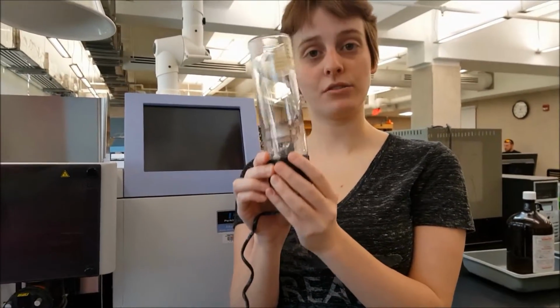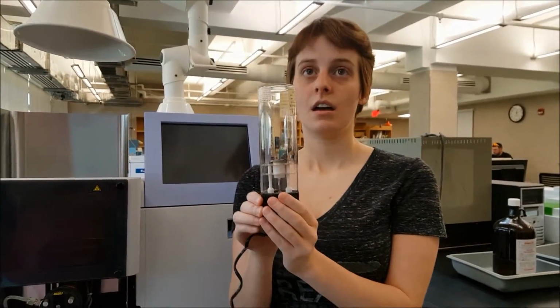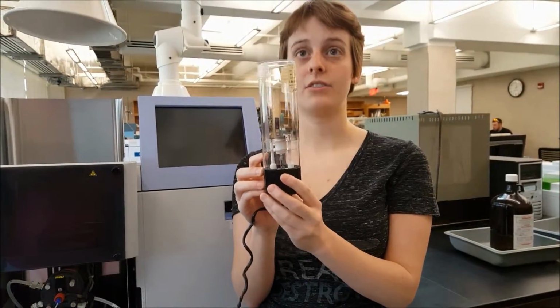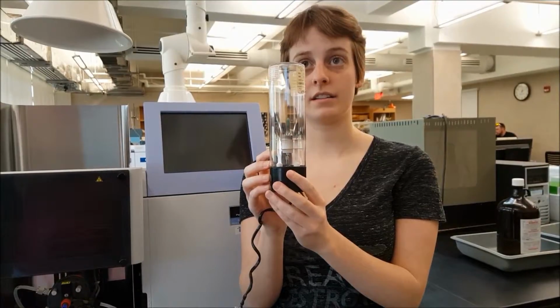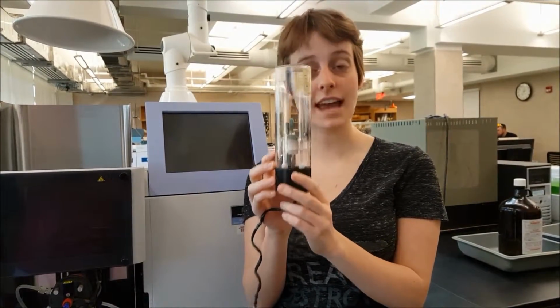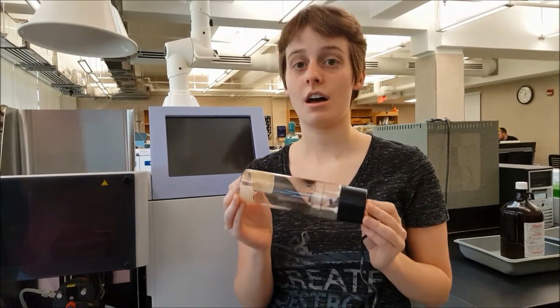It's made of whatever metal you want to observe, which in this case is Ag, or silver. The positive argon ion will collide with the metal cathode and cause the argon to neutralize, and hot metal gas will be released. The hot metal gas releases energy in the form of light, which is in the specific wavelength that you want to see.